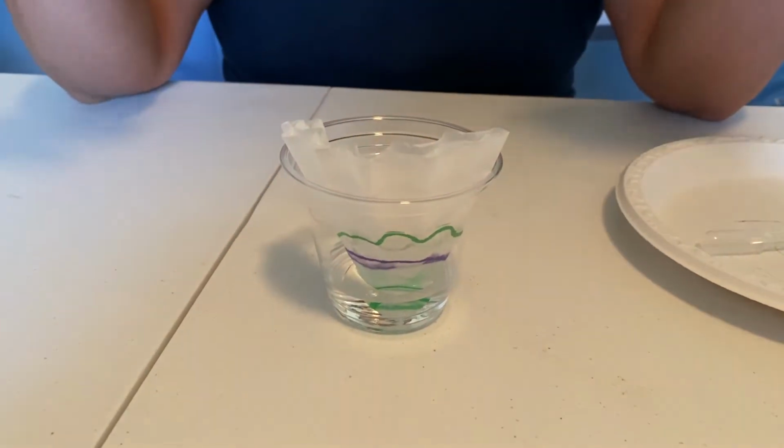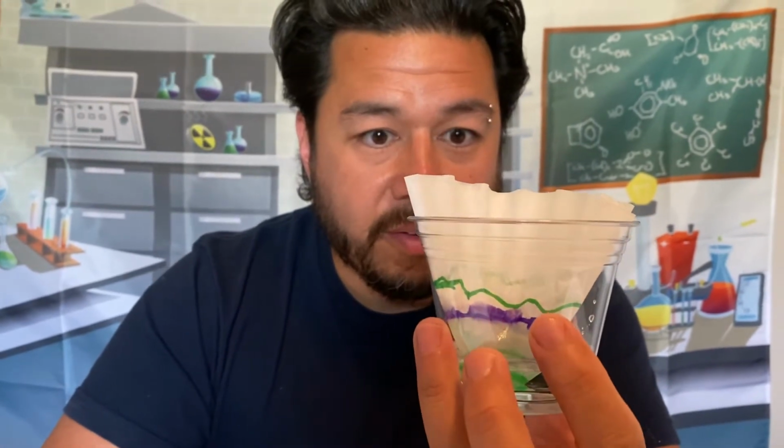So here we go. What's happening right now is it goes up and it's starting to separate. We'll be back.